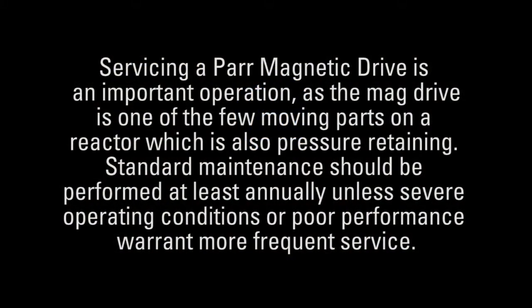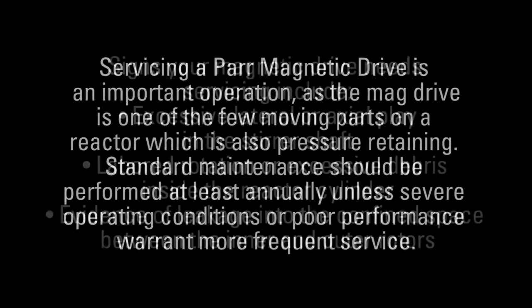Servicing a Parr mag drive is an important operation, as the mag drive is one of the few moving parts on a reactor which is also pressure retaining. Standard maintenance should be performed at least annually unless severe operating conditions or poor performance warrant more frequent service.